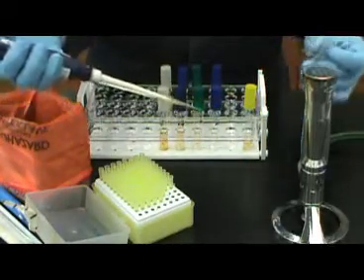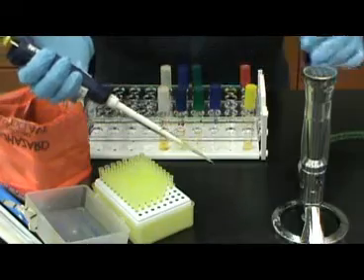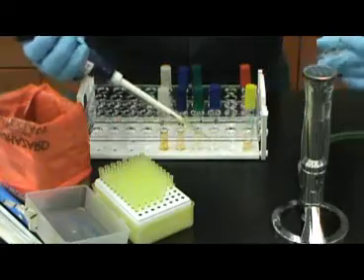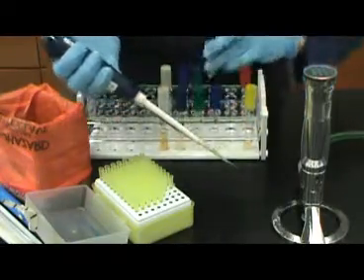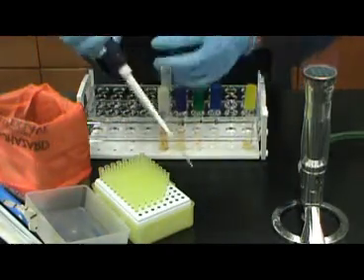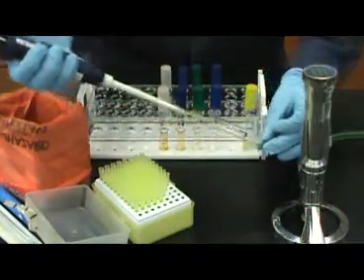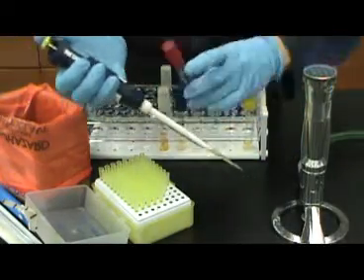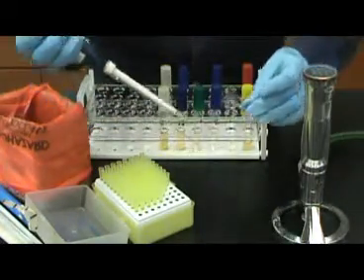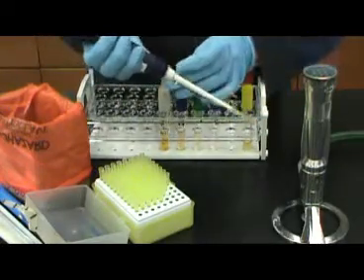You will then aseptically transfer 100 microliters of your stock culture into the first tube containing one of the media. After completing the inoculation, dispose of the tip in the biohazard bin. A new tip will be used for the next inoculation of the next broth. The tip of the micropipette for this particular type of inoculation should always be changed between each bacterial transfer. Use of a micropipette ensures that the exact same volume will be inoculated into each of the 4 broths. Repeat this procedure for the following 3 tubes.